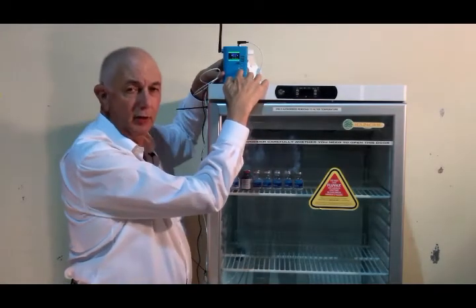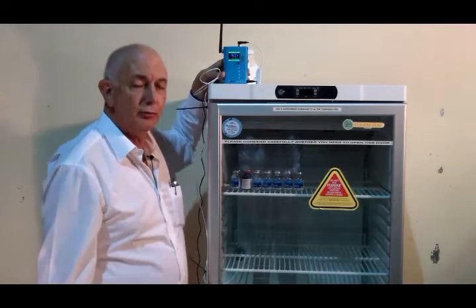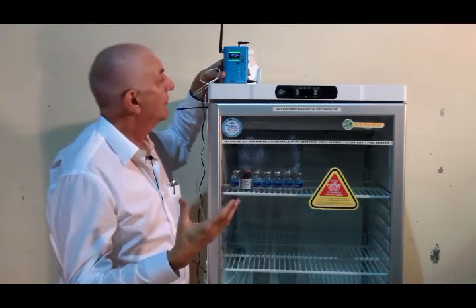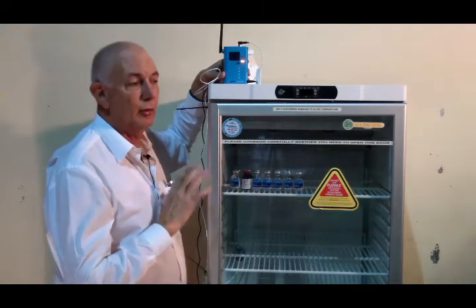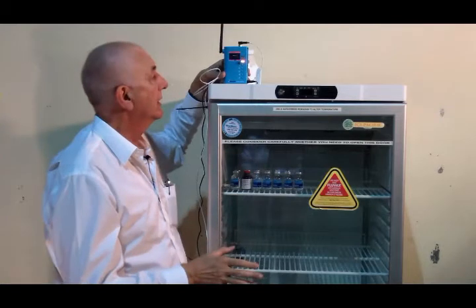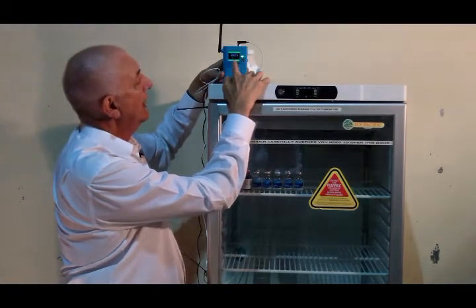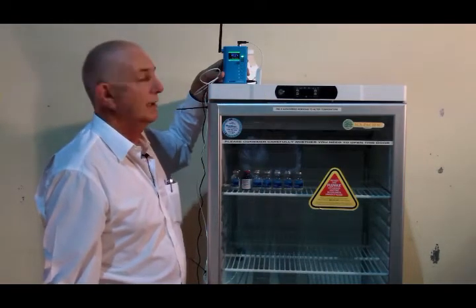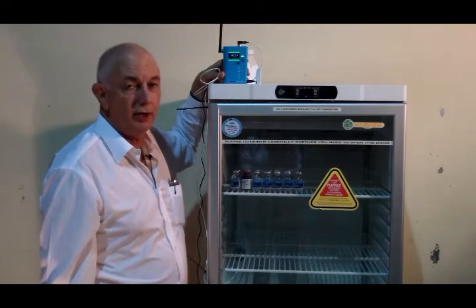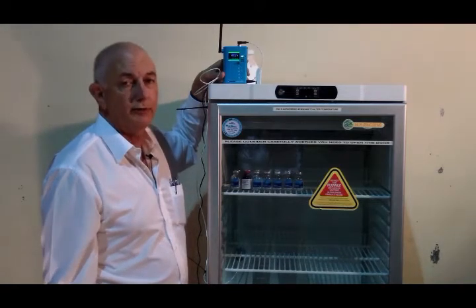By pushing the OK button on the logger, it will actually send a transmission through and check that the cloud is working as well and that all your communications are working. If it comes up with a flashing green light and a green screen after you push the OK button, then that's checked and it's transmitted a reading of the temperature right through and is now stored.